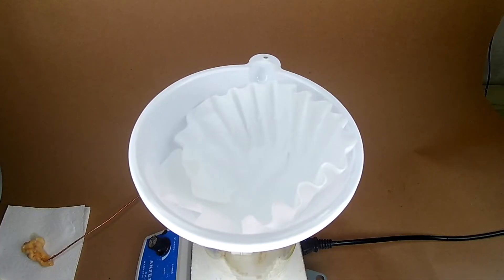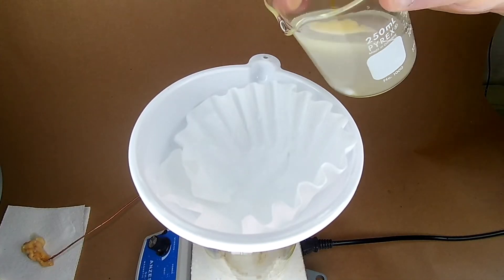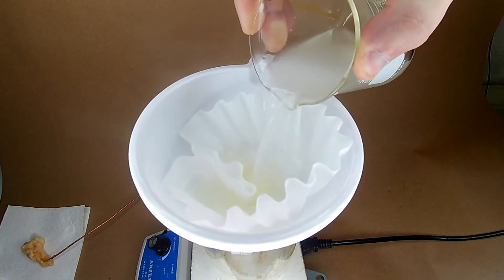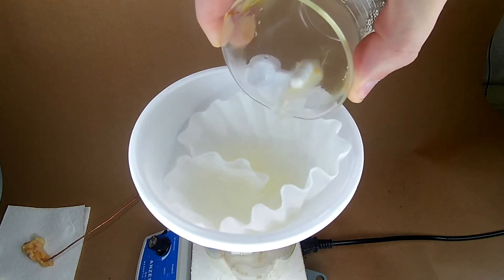After the large chunks were picked out, the solution was strained.